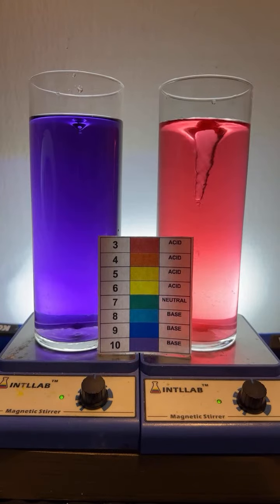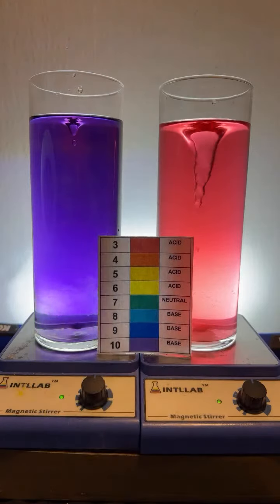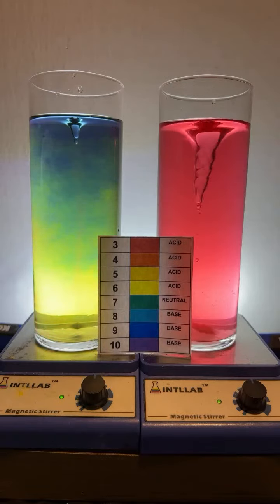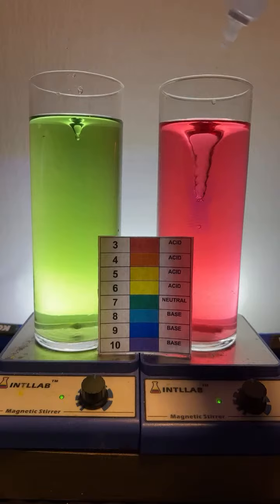Sorry, man. Do I have ice? I do not. All right, let's add some acid over here on the left. A couple drops. Base is the one that tastes bitter. Acids are sour. Make it green. I think I may have done it. I think there's your green. What's the acid and base? The acid I'm using is 20% by weight hydrochloric acid. The base I'm using is 20% by weight sodium hydroxide, with the other 80% coming from water.